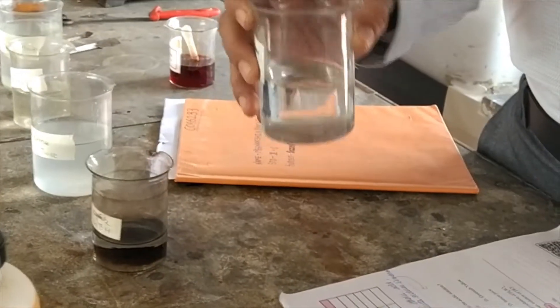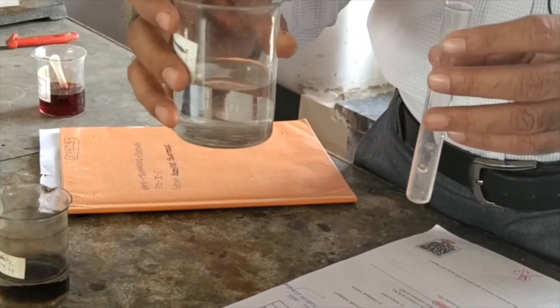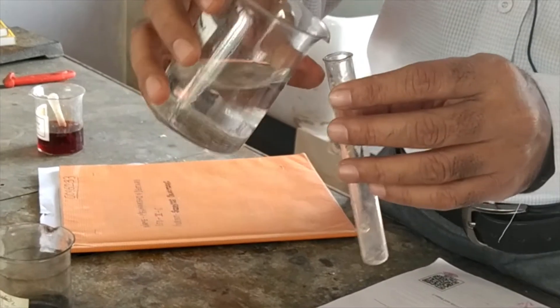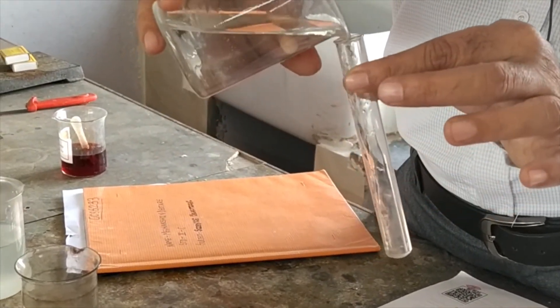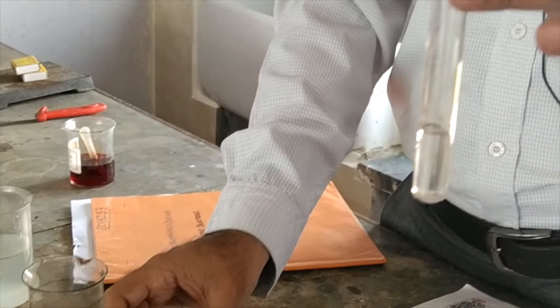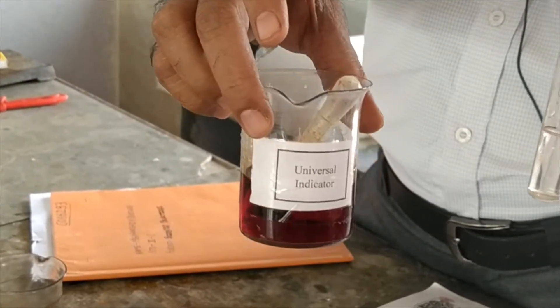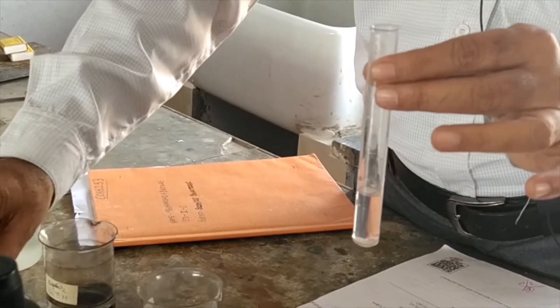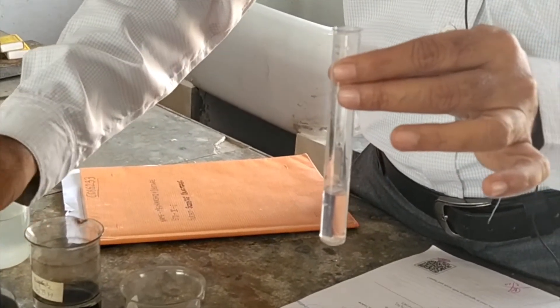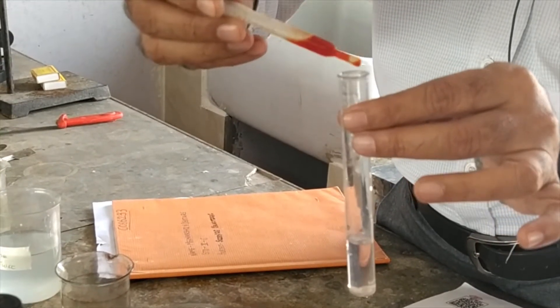Now let us start the experiment. Let us take the first solution, that is dilute hydrochloric acid. Take a small amount of dilute hydrochloric acid into the test tube. Now this is the universal indicator — I am going to use the dropper to put 2 or 3 drops of universal indicator. Observe the color change.